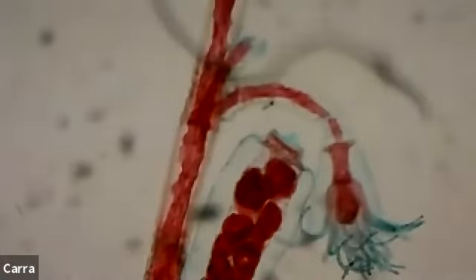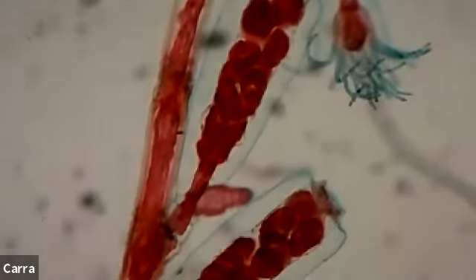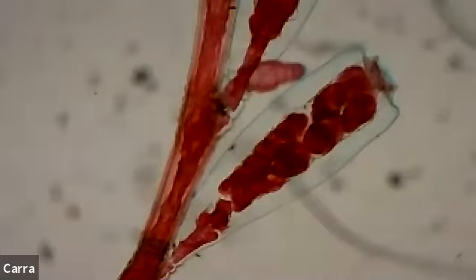And this type form, which I think is really cool, is it has these polyps. So again, let's go down here at the bottom. This is the bottom, but it's not really. This isn't what would connect to the bottom of like the substrate. This would be more like they snapped off a stalk. Okay, so there's the stalk, and then we come up here in this first form, that's a little polyp. It's not very mature, so you can't see its tentacles, but let's keep going up, okay?